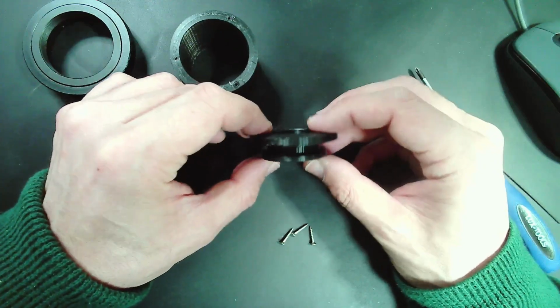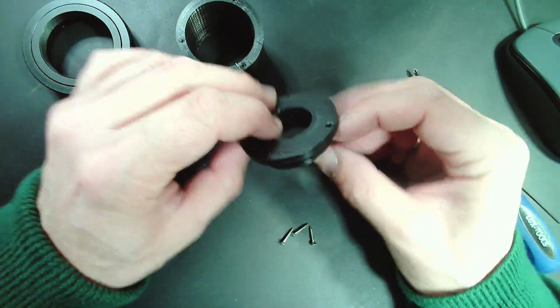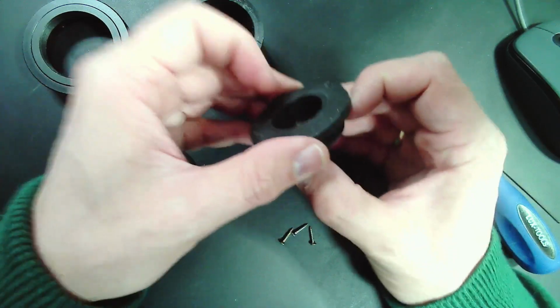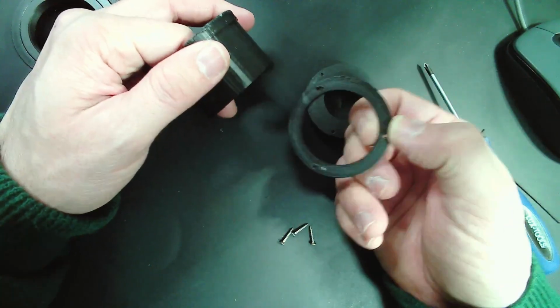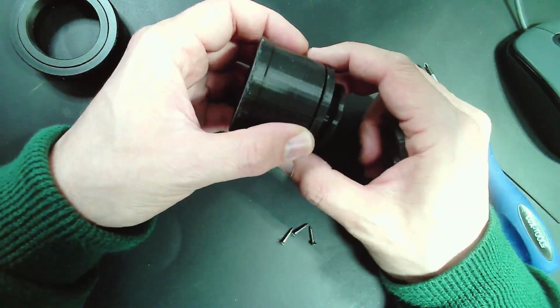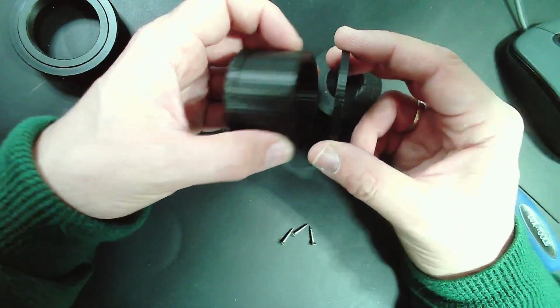This part here is the part that actually connects into the microscope. And here you can see that you can rotate this, so there is a little hexagonal screw that goes in here, and the top part can also rotate without the whole thing coming off. This here is the main part, and what I've got here is a little ring as well, which I added later because I found out that the distance here was too short, so the camera was a little bit out of focus. So instead of printing everything again, I simply decided to add this additional spacer ring.